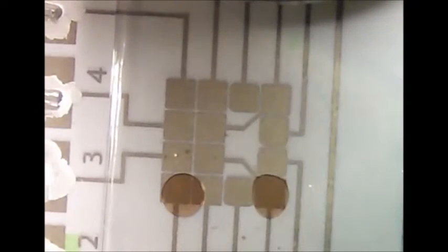Brilliant. And this was just the first try on the first go to try this. Oh, seems to be working. Maybe we can go faster. Yep, that's faster. Now even more fast.